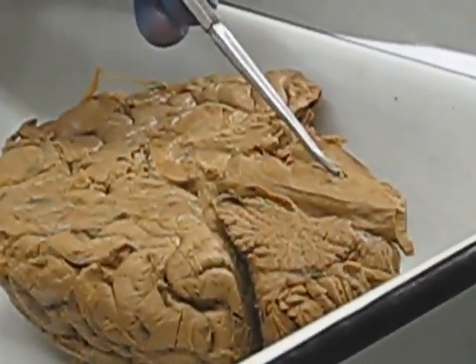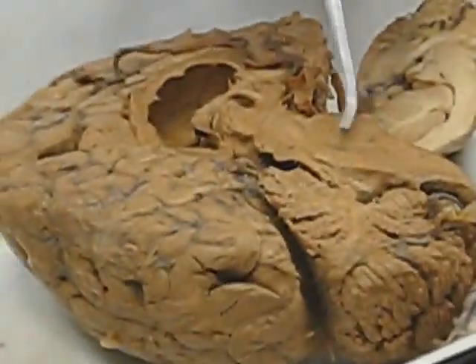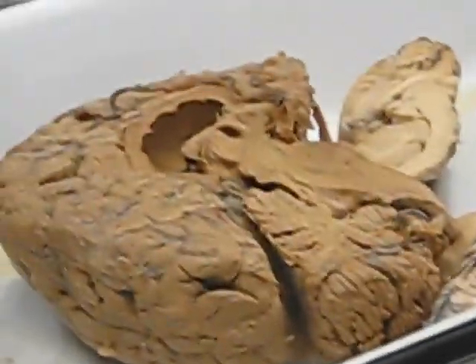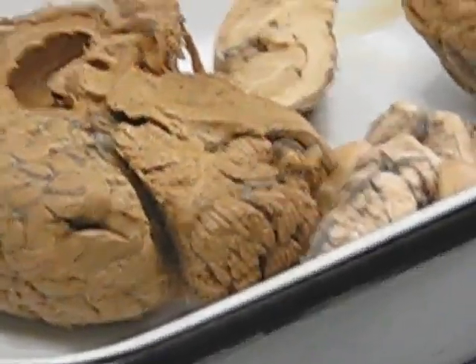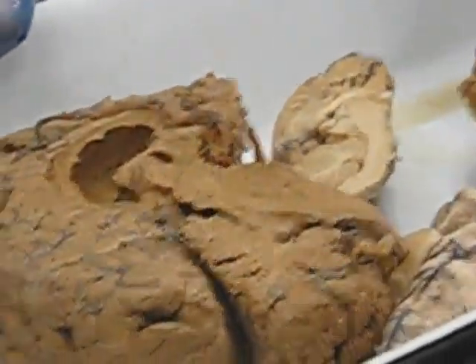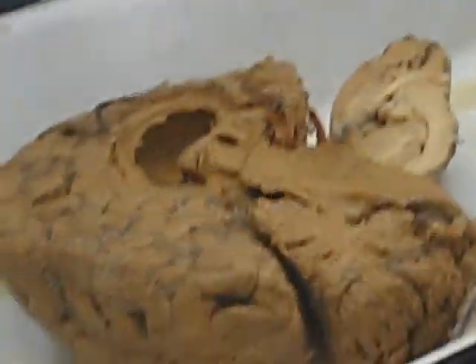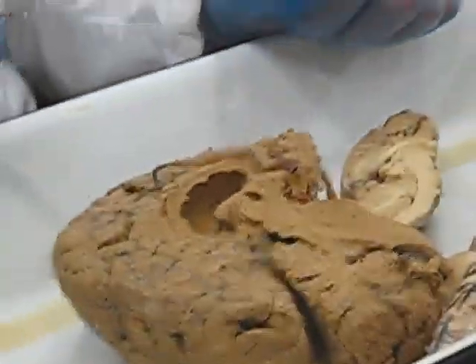Here's the pons. Here it is on this specimen, this big old swollen area. And in this is the medulla oblongata. There it is there. And there it is here. This is the pons. And you can't see the midbrain from there. It's tucked down in. So the brainstem: pons, midbrain, medulla oblongata. Be able to just tick those off. Brainstem.